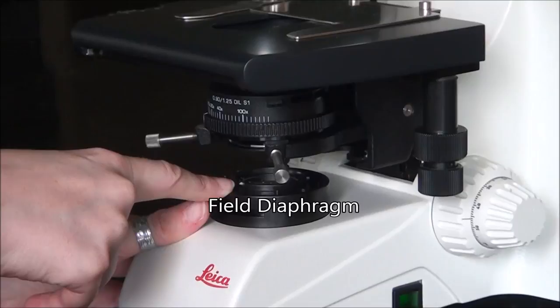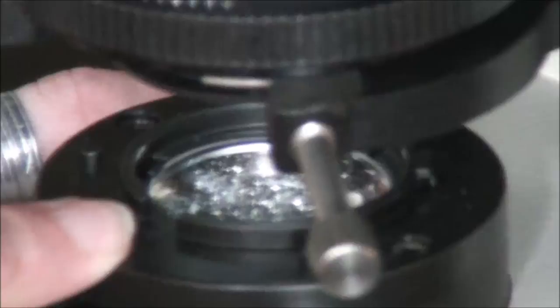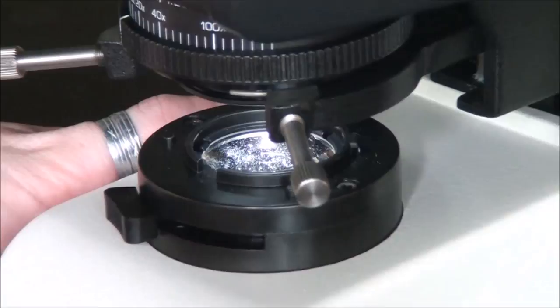Check the right-hand base of the microscope by opening up your field diaphragm to see if you can see any light coming through, and you can always turn up the intensity wheel, which is literally on the opposite side of the light switch, to double check that you have light coming through.